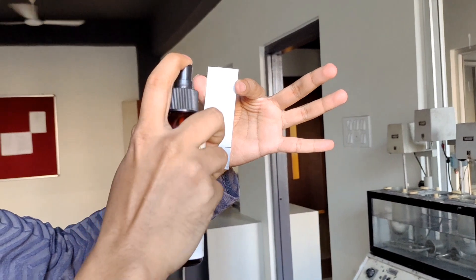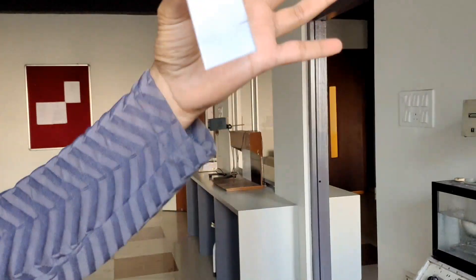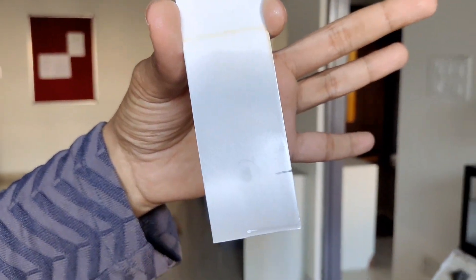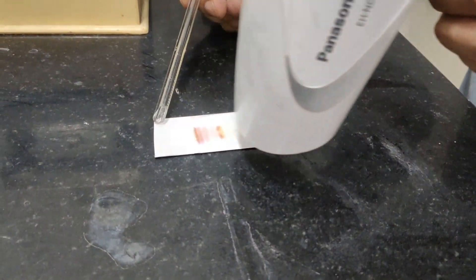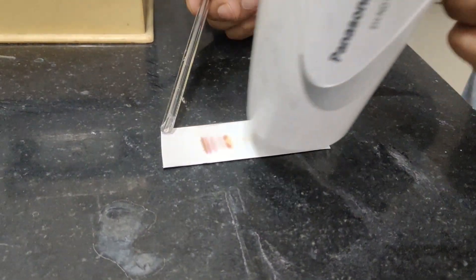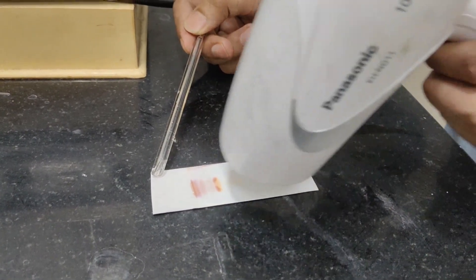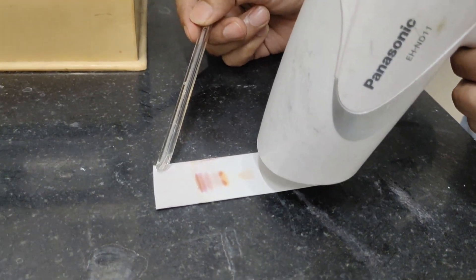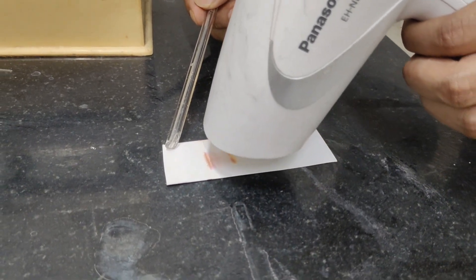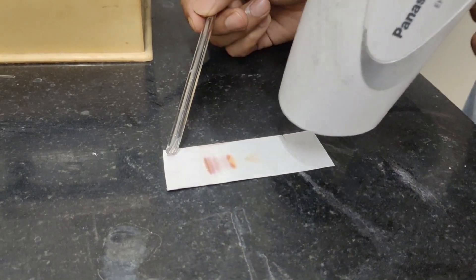Sir has taken it out. After drying, he is spraying it with ninhydrin solution. The solvent is evaporated, and now the plate is being dried with a dryer. You can see distinct color spots coming on it. What was initially one sample, we are now seeing distinct marks — distinct color spots at different heights. Each one of these spots represents one amino acid.